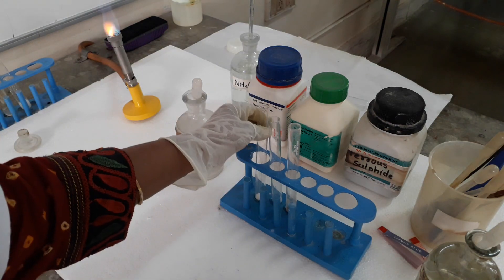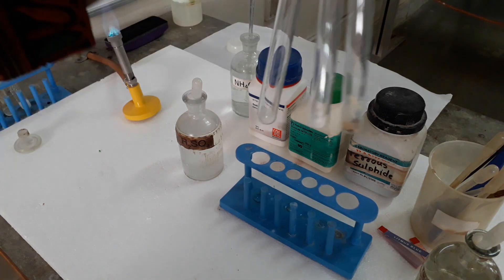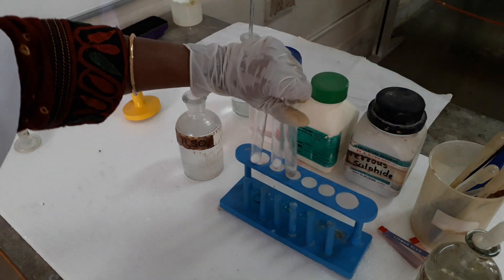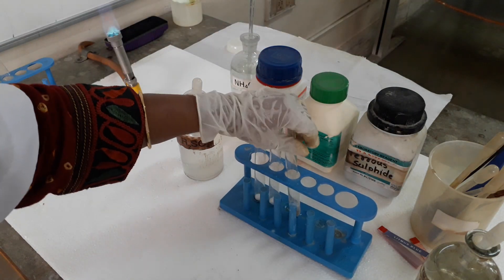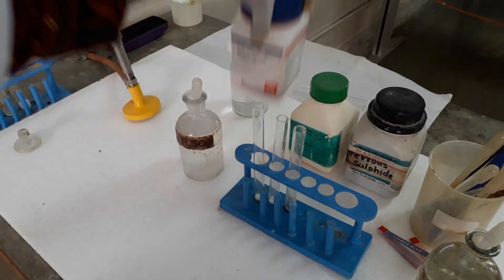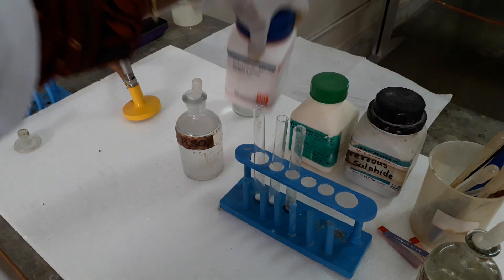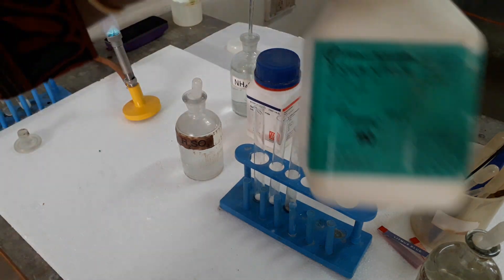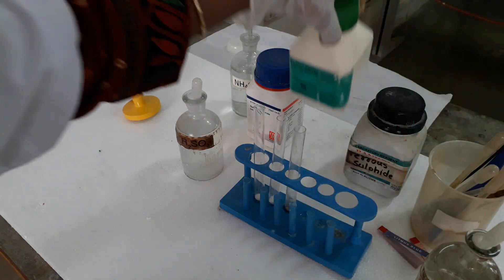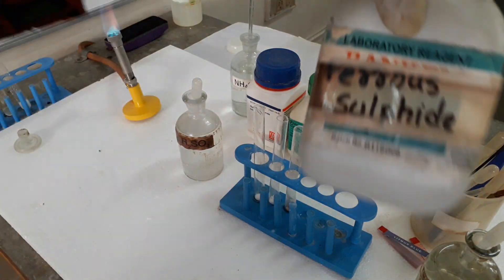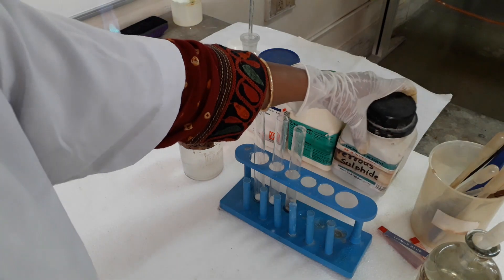For this I have taken all three salts in test tubes. Here we have sodium chloride for chloride detection, a nitrate salt for NO3 minus nitrate detection, and ferrous sulfide for S2 minus sulfide detection.